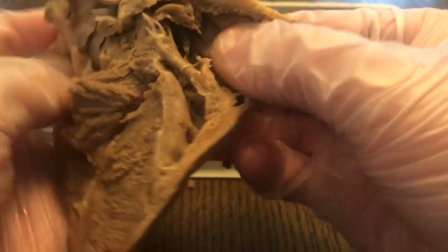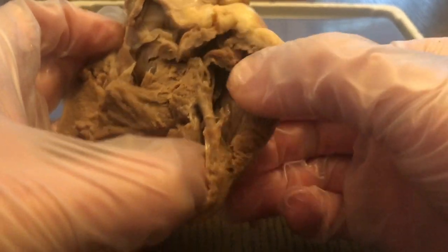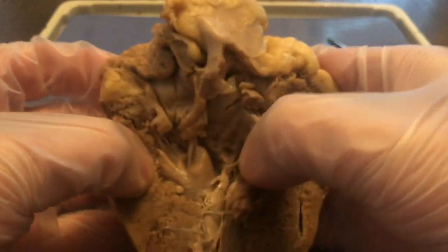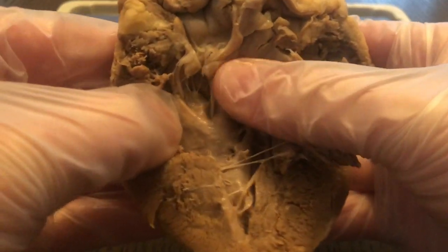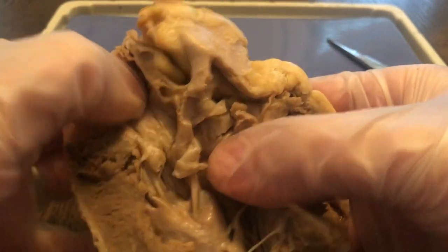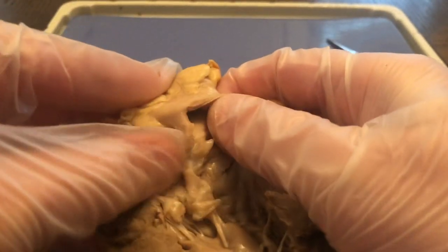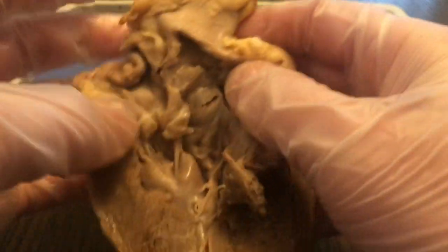So you can see the chambers in here. In a human heart, a mammal heart will have 4 chambers, 2 atria and 2 ventricles. So you can see the valve strings here that open and close, and you can see the blood vessels in the major aorta right here, in which blood will leave the heart.